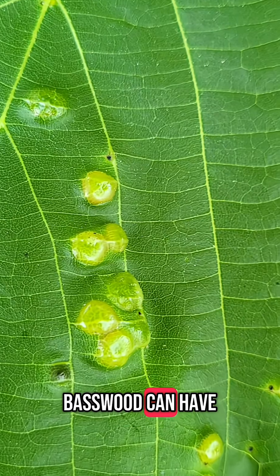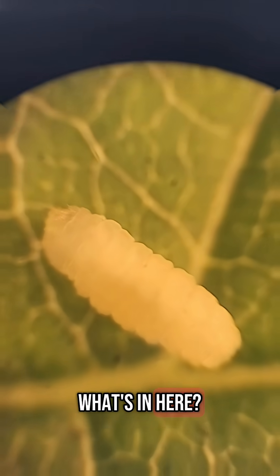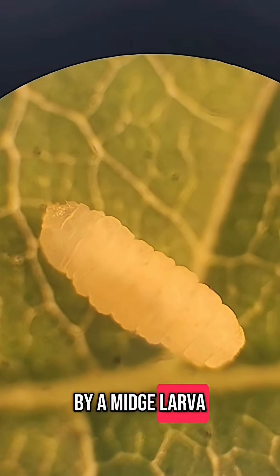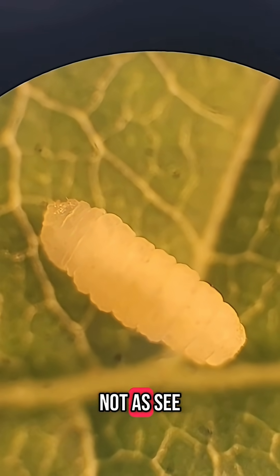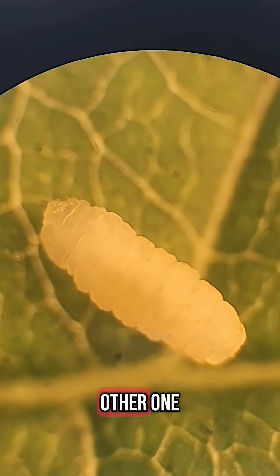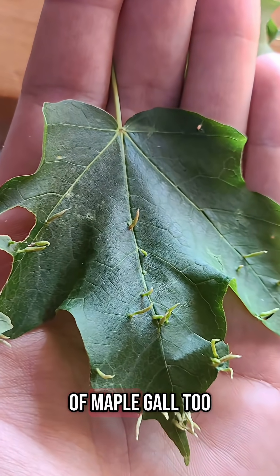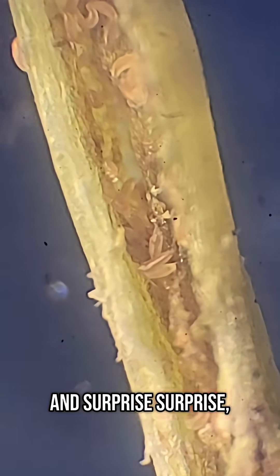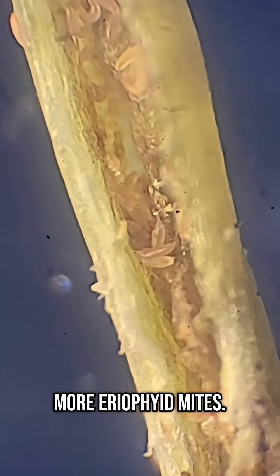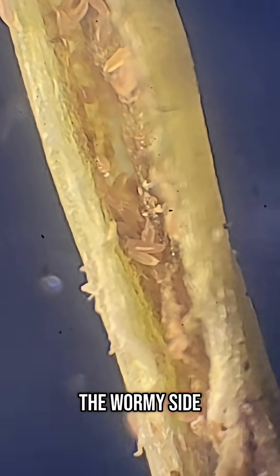Basswood can have other galls too. What's in here? Looks like these are also caused by a midge larva, but this guy looks totally different — not as see-through as the other one. We got a different kind of maple gall too, and surprise, surprise, more eriophyid mites. They're also a little bit on the wormy side.